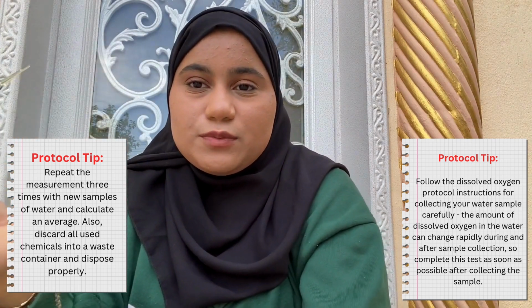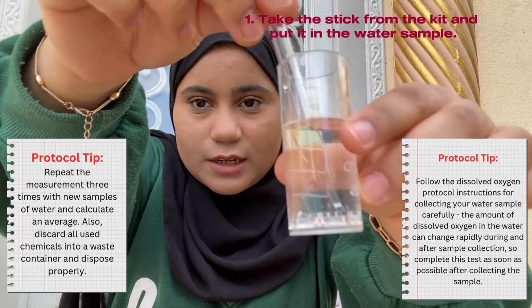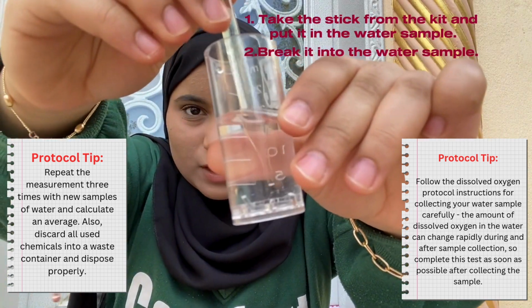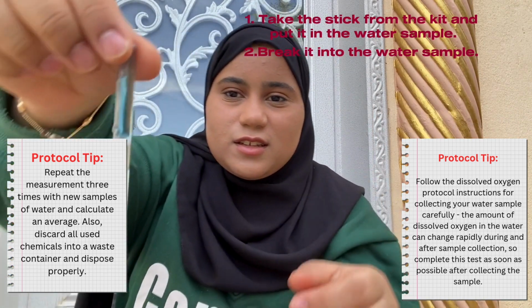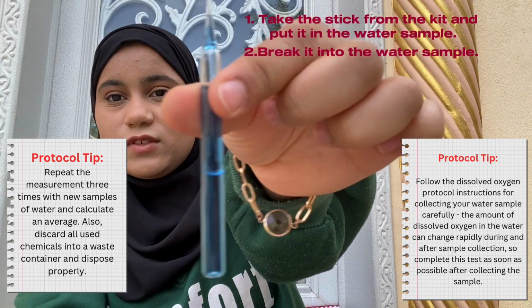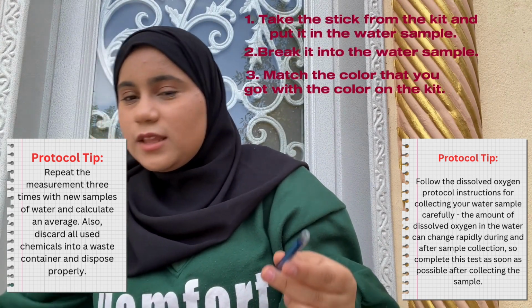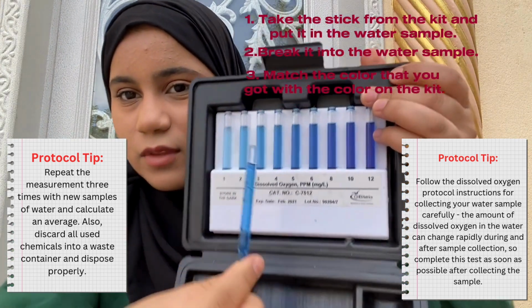What you're going to do is pretty fun, pretty easy. You're just going to put it in there, then stick it, break it, and wait for it to change color. That's magic right there. And then after it gets mixed, you're going to match the color that you got with these guys right here. So let's match it.